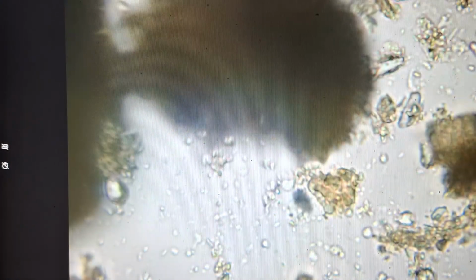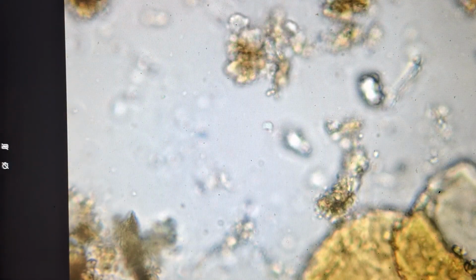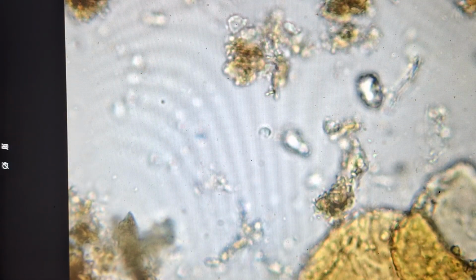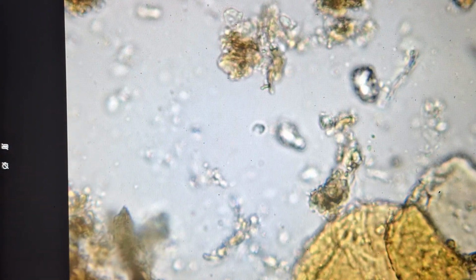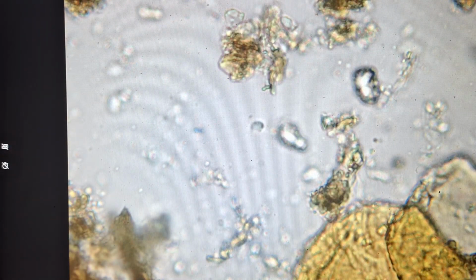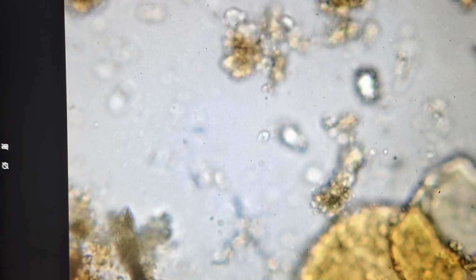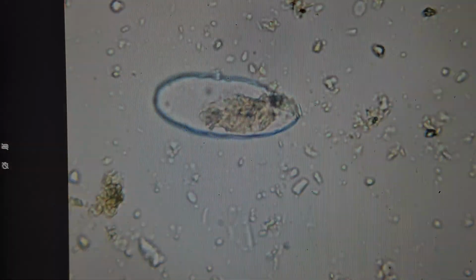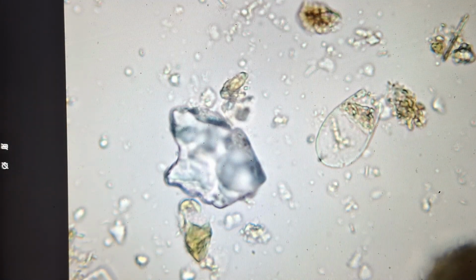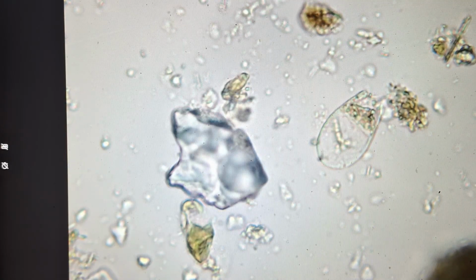And we'll just do a quick look and see if we find a protozoa without zooming out. Oh, there's a flagellate right away. We'll see him here zooming, bouncing around a little bit. There he goes, off of that flagellum. And there's a shelled amoeba. Another good-looking testate amoeba. Mouth is very obvious on this one, on that end.